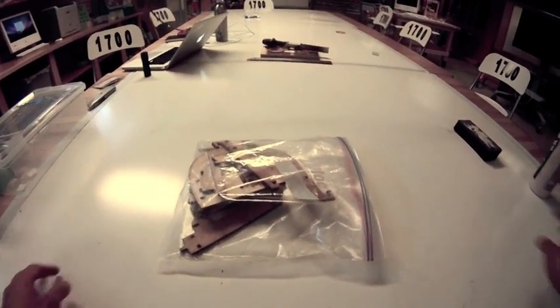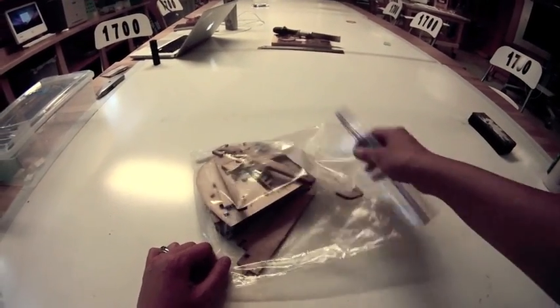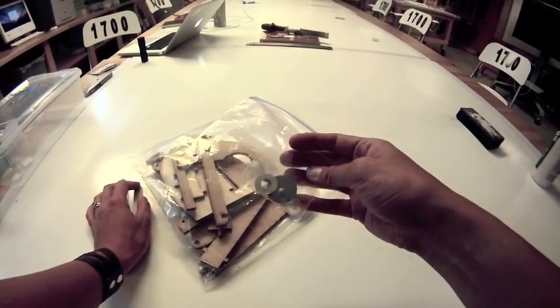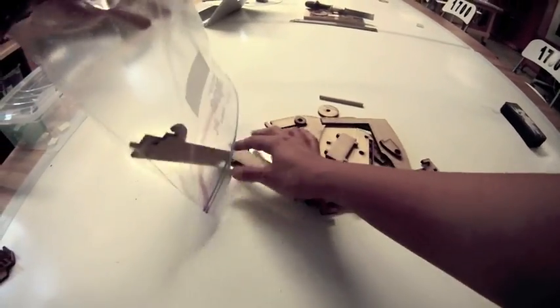I'm going to be showing you how to build a microscope today out of this bag of parts. Every one of you should have gotten a Ziploc bag full of parts, so let's start by sorting through the parts. Take out the little tiny Ziploc bag that's in the big bag, put that aside for now, and then dump out all the wooden parts.